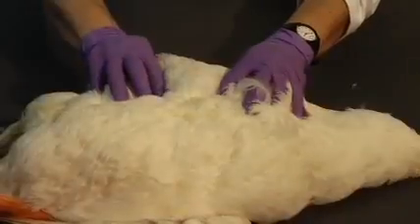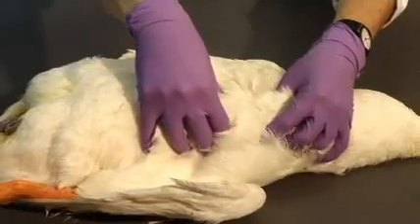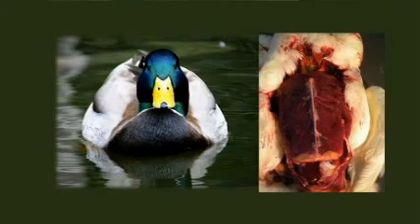Assess the body condition of the duck by palpating the amount of pectoral muscles in the breast region. Note that the conformation of the sternum in ducks is specially adapted to swimming and floating. The breast is flat and consists of large amounts of cartilaginous tissue at the level of the ribs.